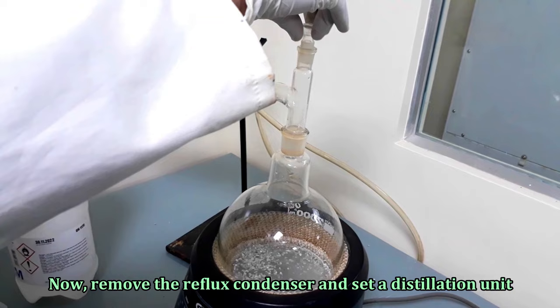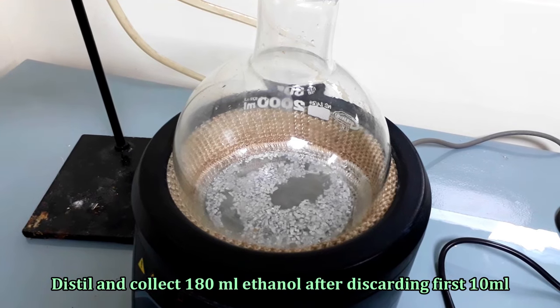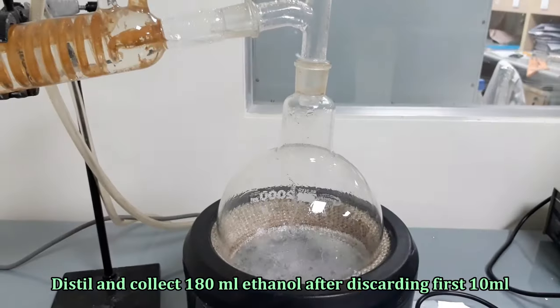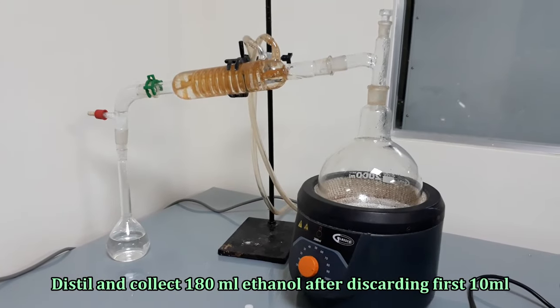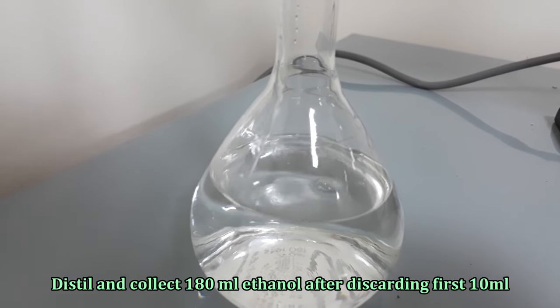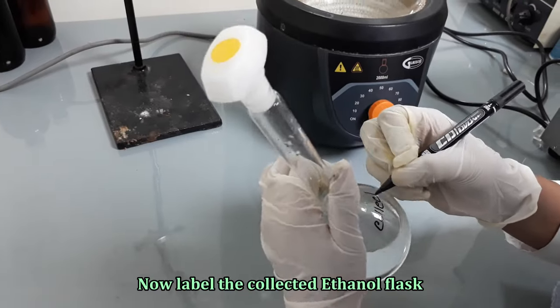After 30 minutes of reflux, remove the reflux condenser and set a distillation unit with the flask. Distill and collect 180 ml ethanol after discarding the first 10 ml. Now turn off the heating of the distillation unit and label the collected ethanol flask.